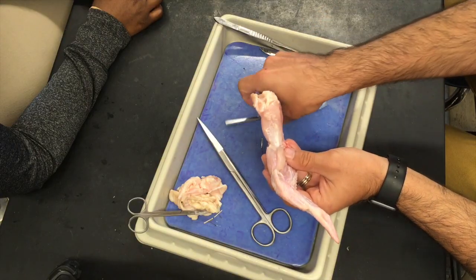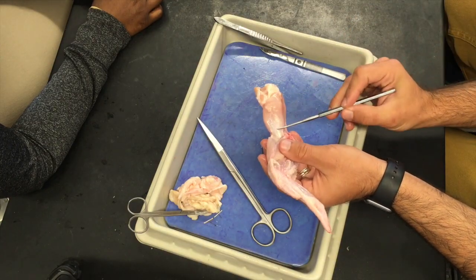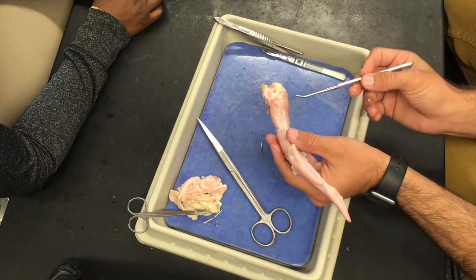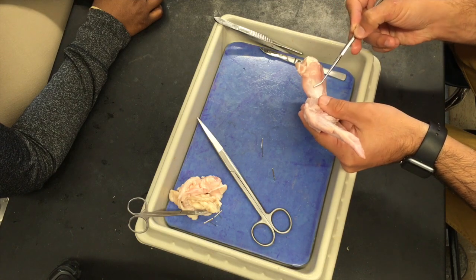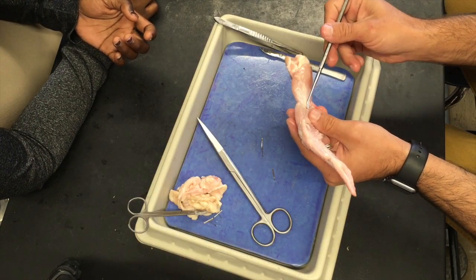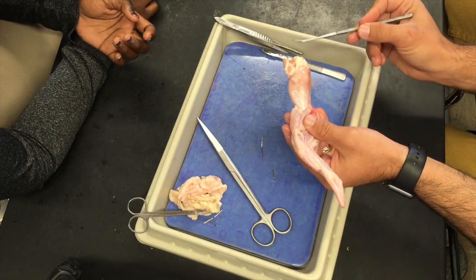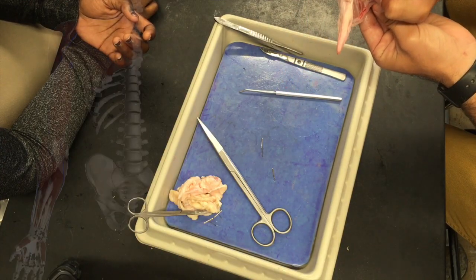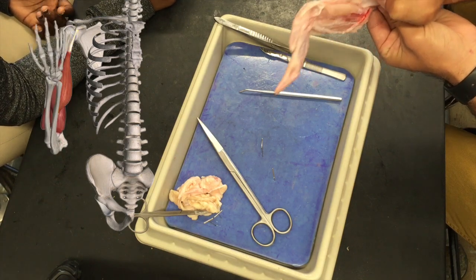What's this? Muscle. What muscle? The bicep. Your bicep. The reason they call it bicep — we have one half of this muscle right here, another half of this muscle over here. So it's actually two parts of a muscle that make up the bicep. Now, it turns to this white-silver color right here. What's this white-silver band going down here? It's a tendon. What do tendons do? They connect muscles to bone. So there's a bone in there — it's actually connecting to the radius. This muscle is going to pull on the radius, and it's also attached up here to the shoulder. So when I flex the bicep, it comes up. You pull on that bicep, and it's going to move that joint. That's all I'm doing is pulling the bicep — that's how that joint works.